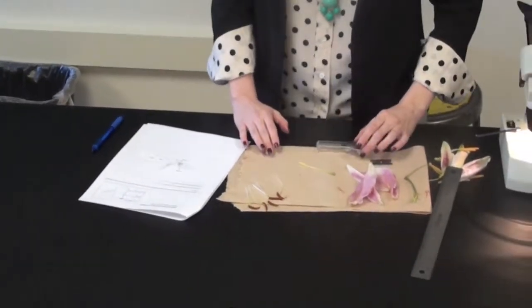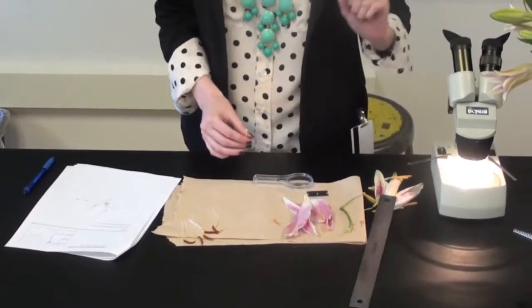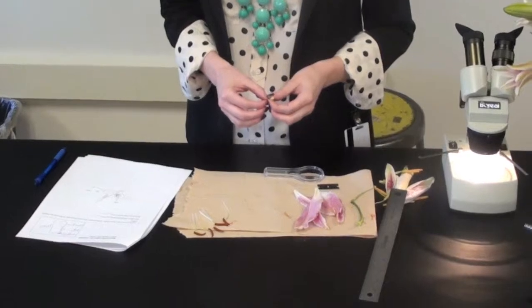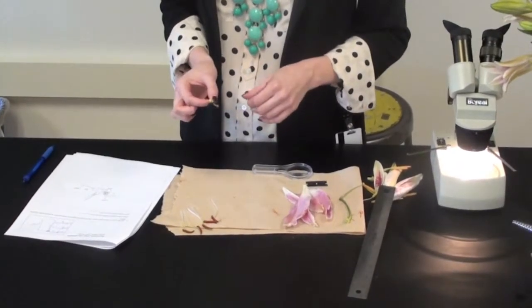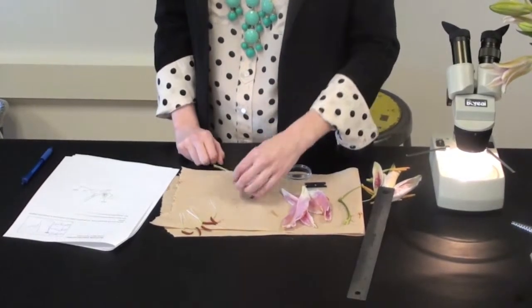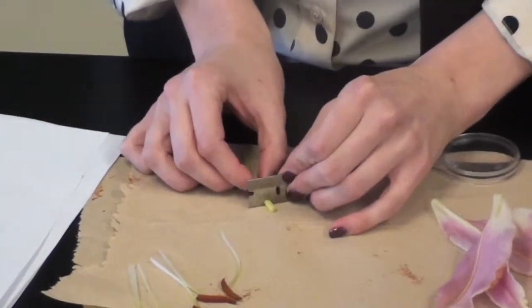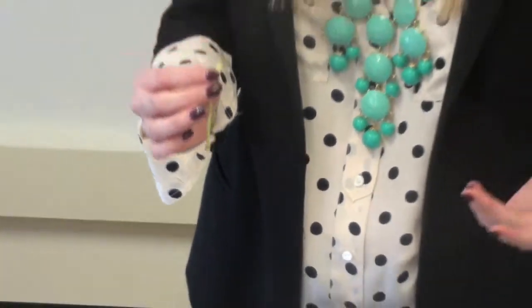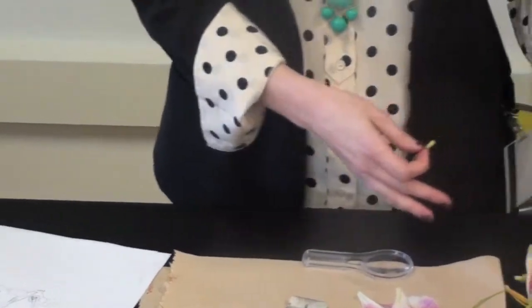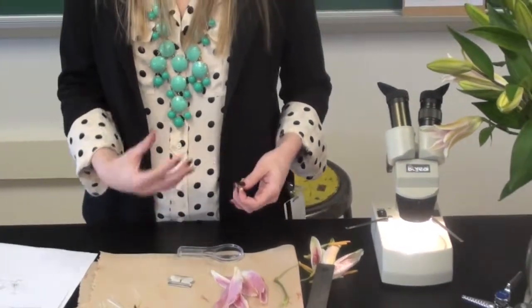Now this last part, which I think we should have time to do, is kind of interesting to see, especially if we use the microscope to take a look at it. We're actually going to cut the pistil in half, and we are going to observe the small compartments inside of the pistil that contain the ovules, which contain the seeds of the plant. So all you're going to do on this step here is take the razor blade and give it a little slice. And with the naked eye, you can see that there are three compartments inside of this flower, but we're going to actually put it underneath the microscope and dye it with a little bit of iodine so we can actually see the ovules inside, which contain the seeds.